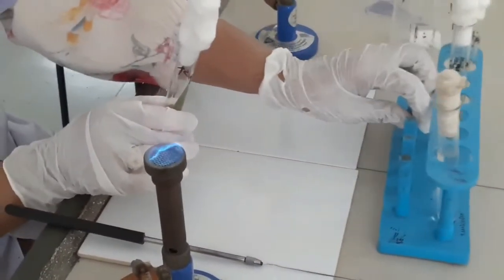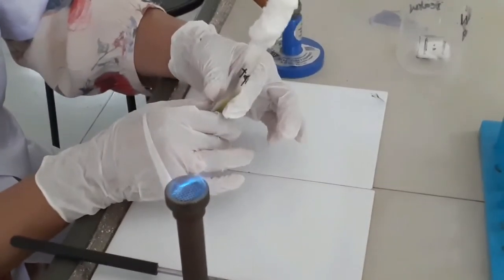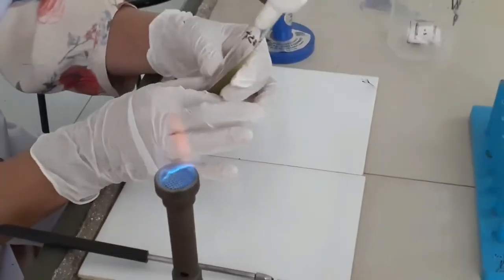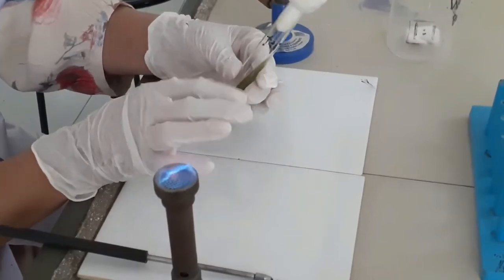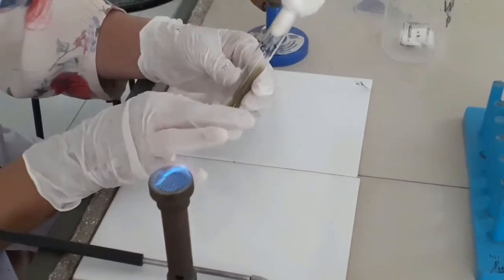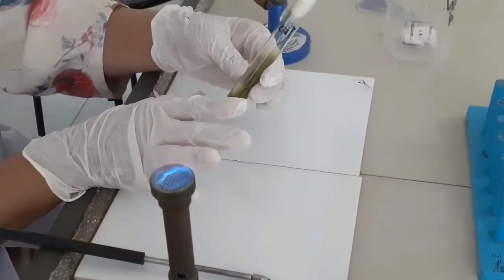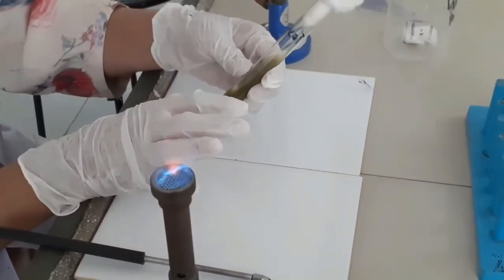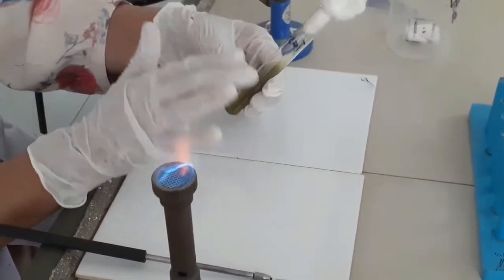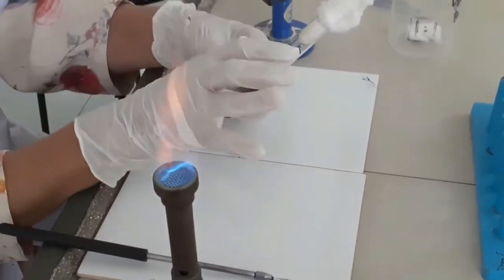After the incubation period, the positive control slant will turn blue and the negative control slant will remain as such. If the slant inoculated with the test organism shows no change in the color of the slant and no growth over the streaked surface, then we can say that the test organism is giving this test negative.